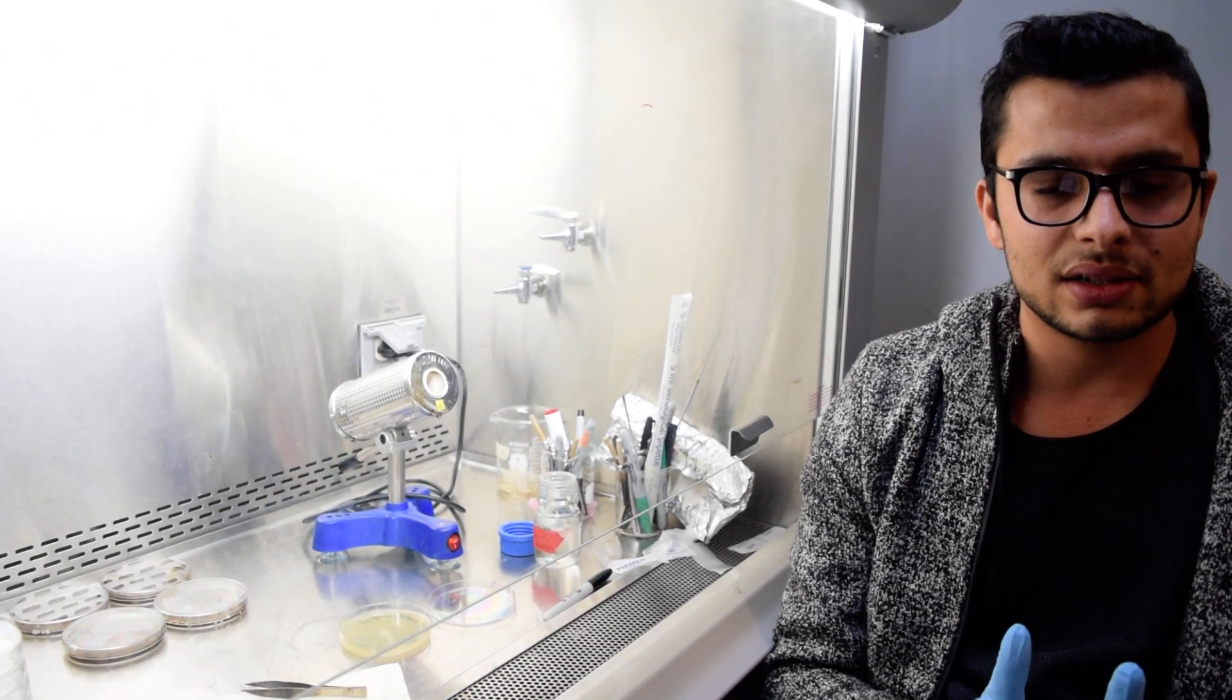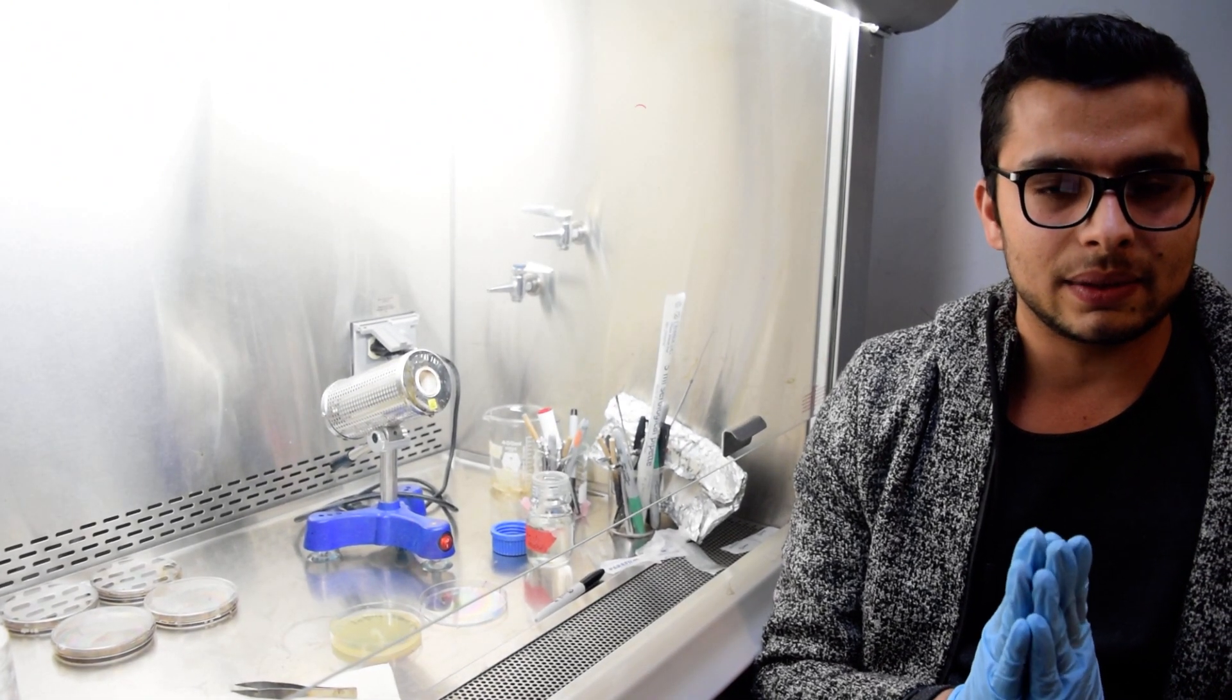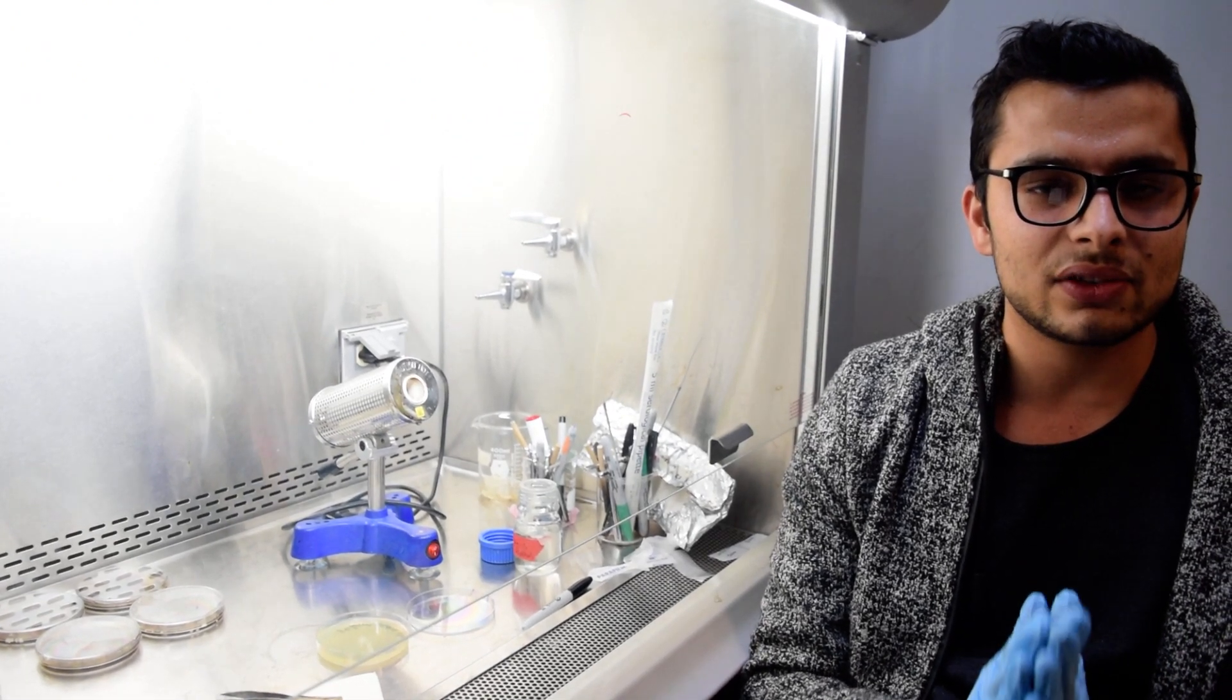After washing with water, the samples should be dried with a paper towel. An important step is the media preparation. The media is the growing medium for any organisms.